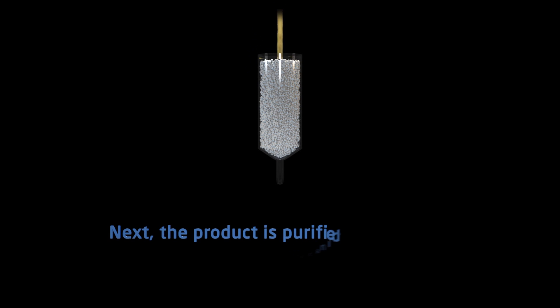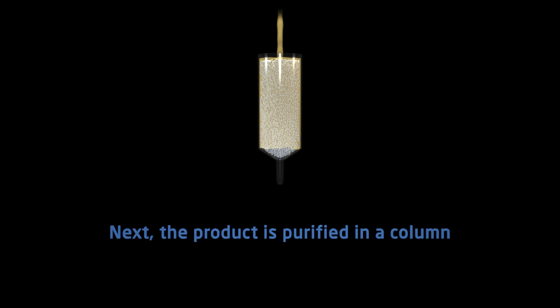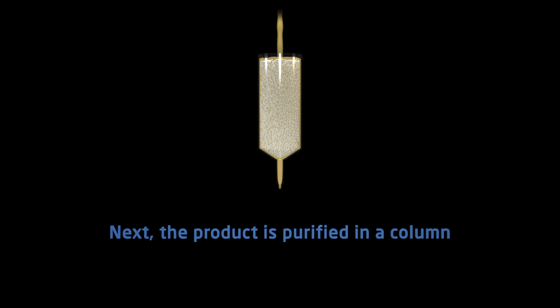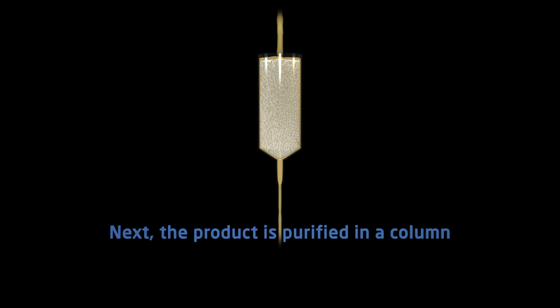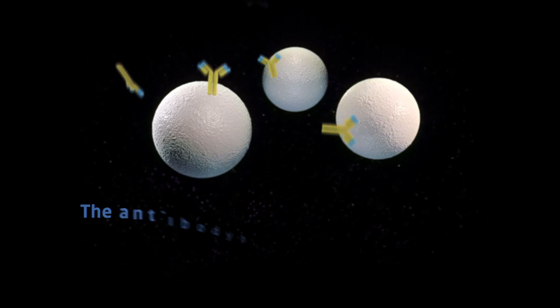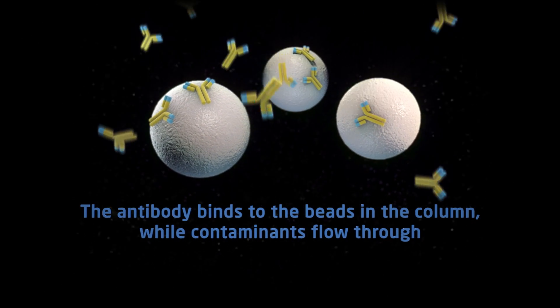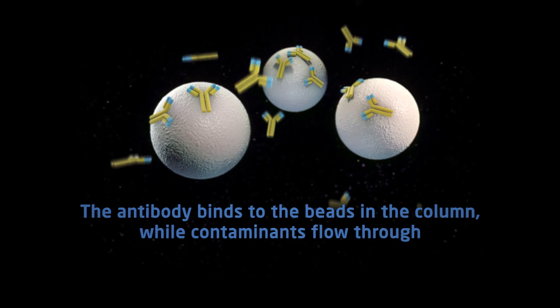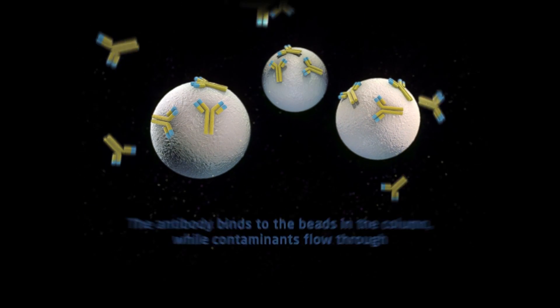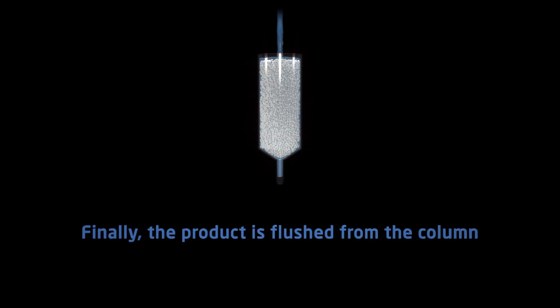Next, the product is purified in a column. The antibody binds to the beads in the column while contaminants flow through. Finally, the product is flushed from the column.